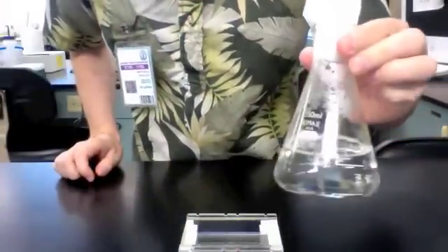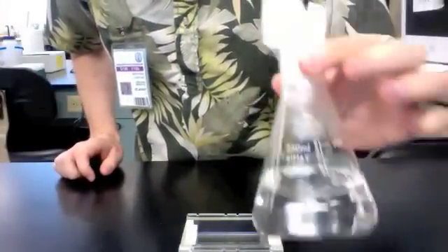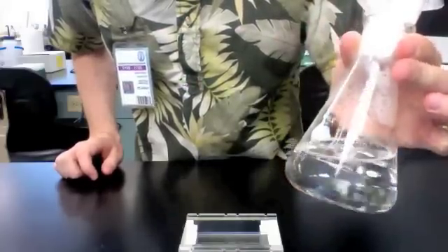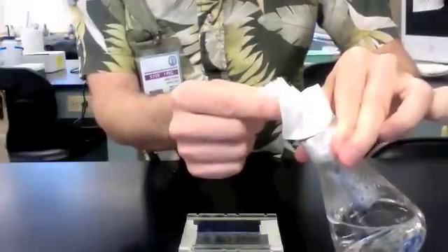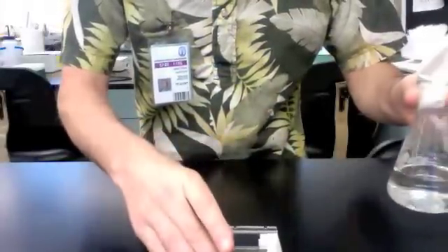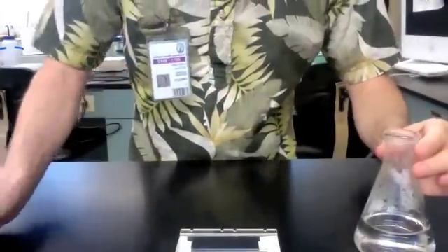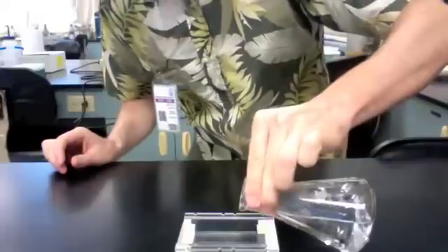Now that we have microwaved the agarose gel in the buffer, it's nice and clear with no floaties. It's hot and ready to be poured. I microwaved it with this towel in the neck to make sure it didn't boil over. Now we have our gel mold. I'm going to take this off and pour it just about to the top, just like this.